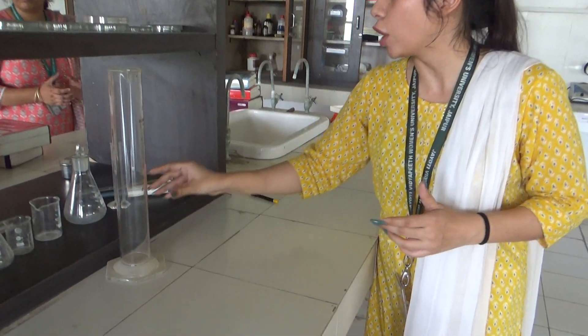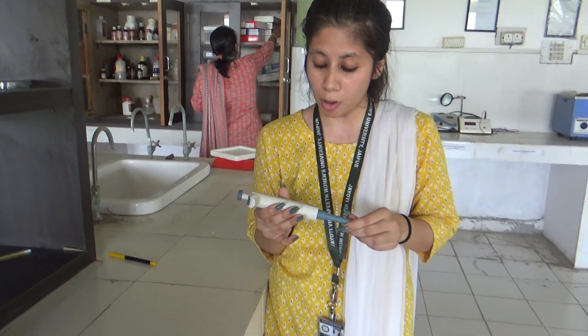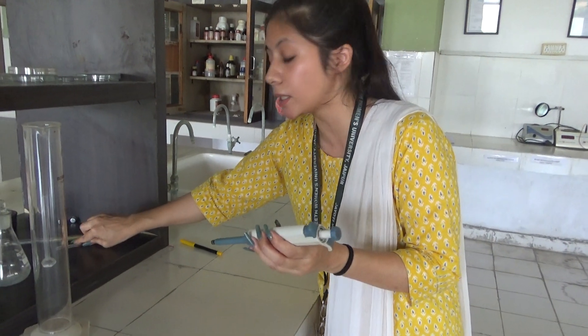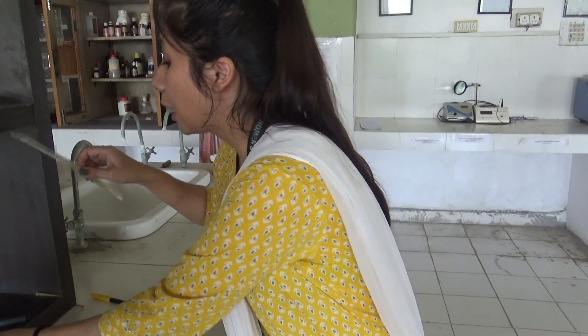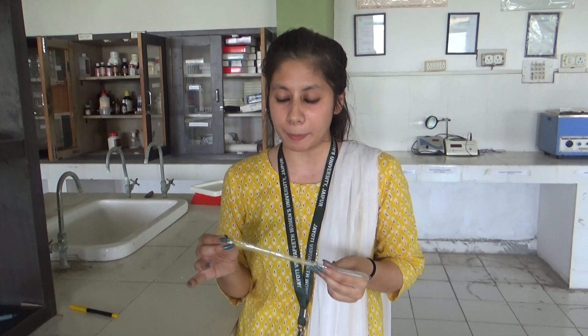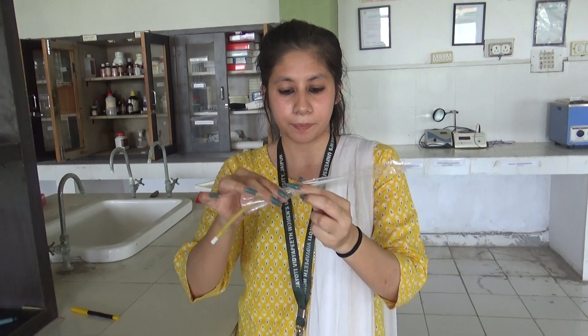Some glassware also available in the pathology lab are pipettes. Pipettes are of various types — there are micropipettes, some pipettes are made of glass. This is the micropipette that is used for collection of blood. Another type of pipette is the WBC pipette and RBC pipette. The WBC pipette is identified by the white bead available inside it.